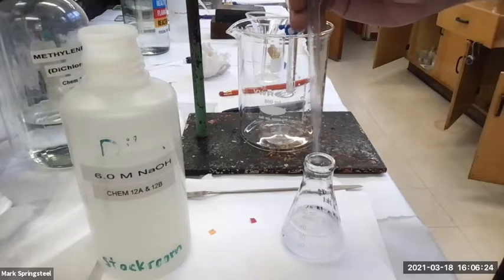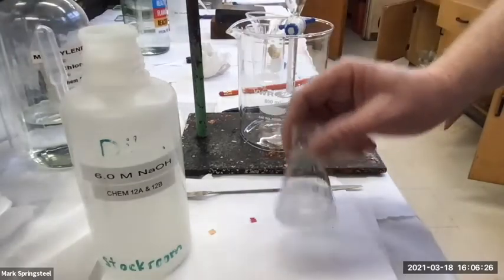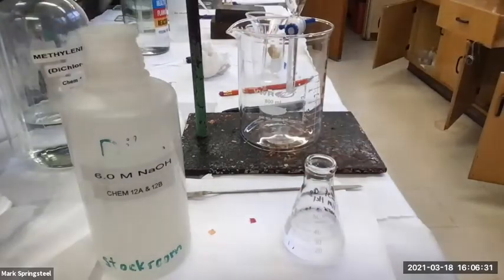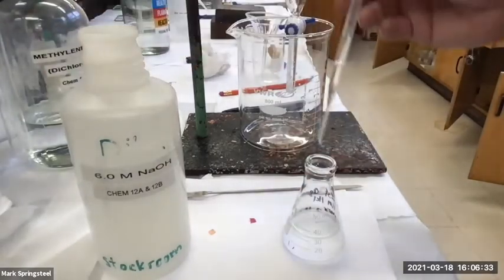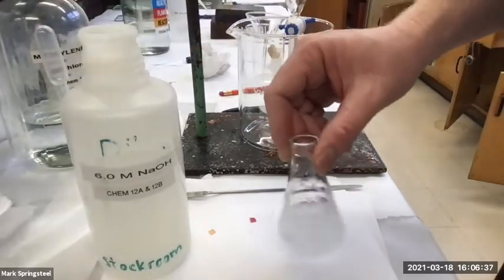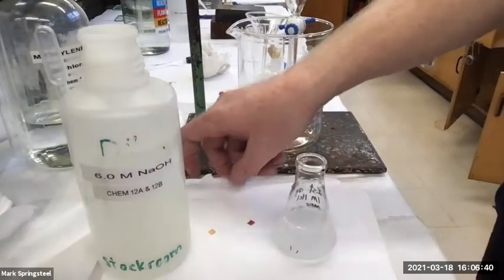What do you think? I think a precipitate is forming and then disappearing, but I can't quite tell because of the white background. It does kind of look like a precipitate, huh? Yeah. But it's pretty mild. Let's check. I just added another squirt. I did about 3 squirts. So I think I've added plenty to make it basic.